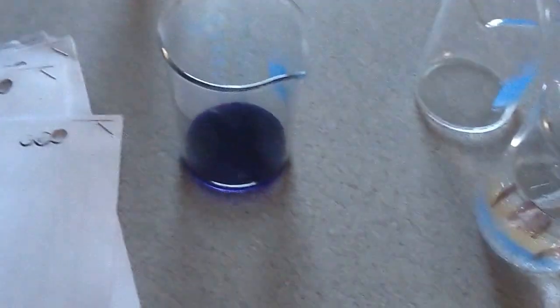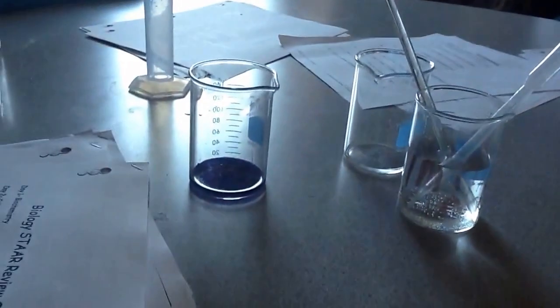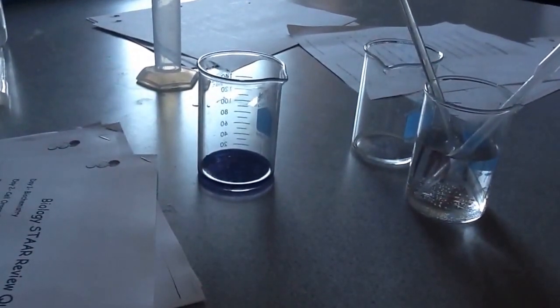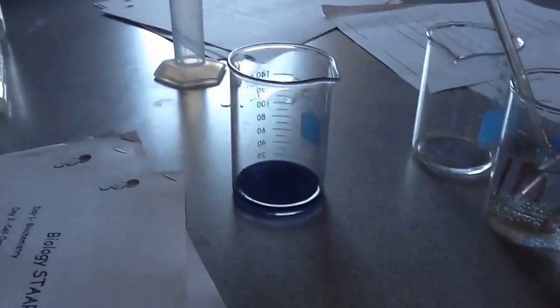So the color change, because I had a base, when I have my color change, you notice I started green and it turned into a blue. It's purple, right? That's because the base has a color change with it.